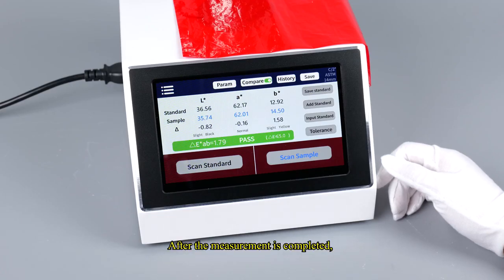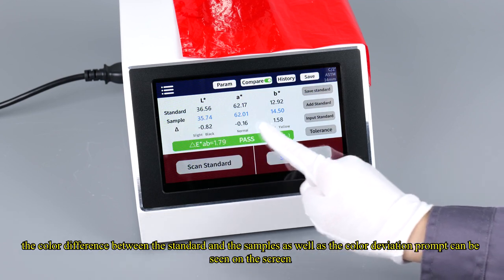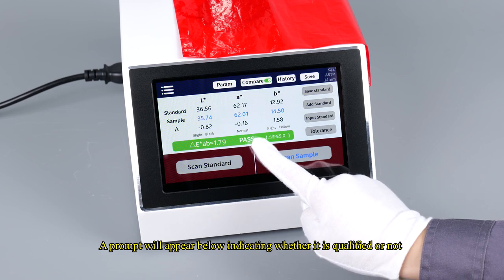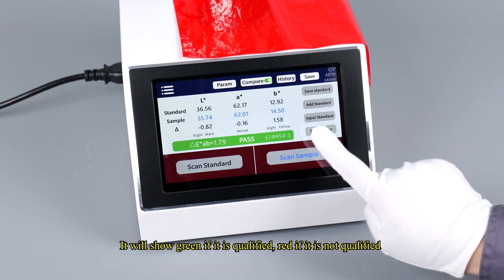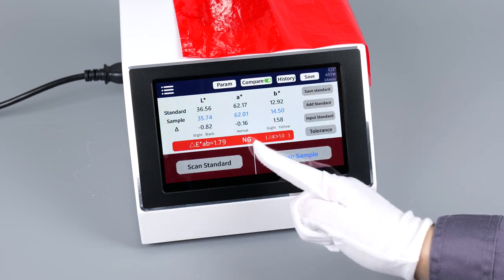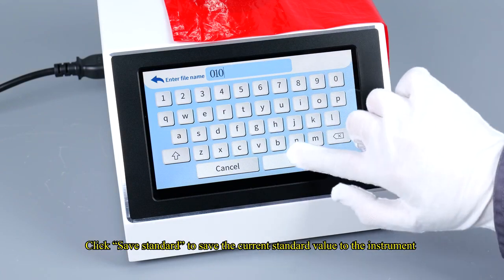After the measurement is completed, the color difference between the standard and the samples as well as the color deviation prompt can be seen on the screen. A prompt will appear below indicating whether it is qualified or not. It will show green if it is qualified, red if it is not qualified. Tolerance can be set by yourself in the tolerance settings. Click Save Standard to save the current standard value to the instrument.